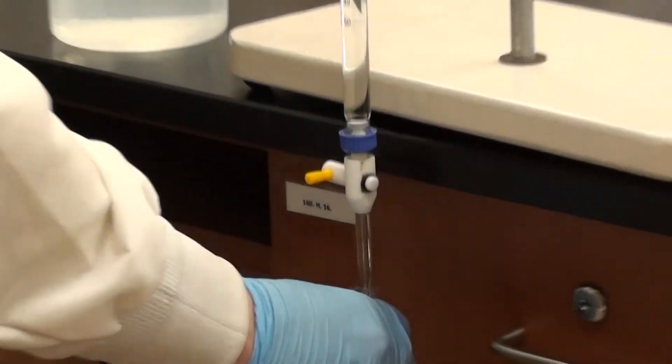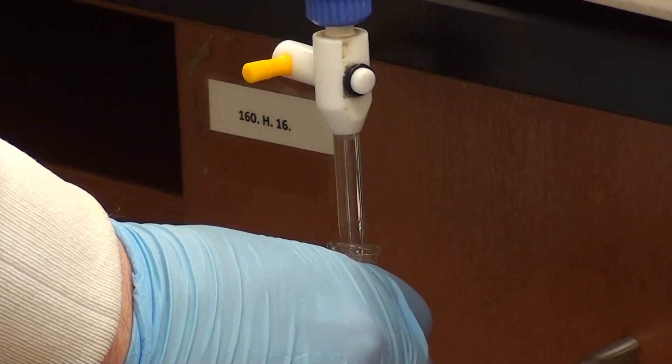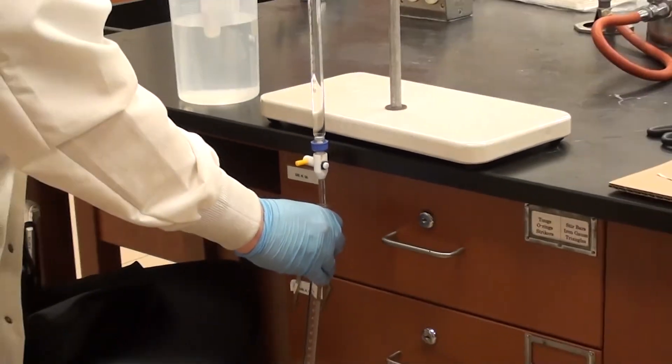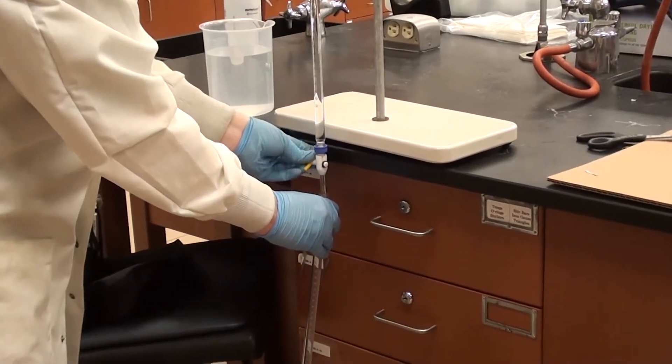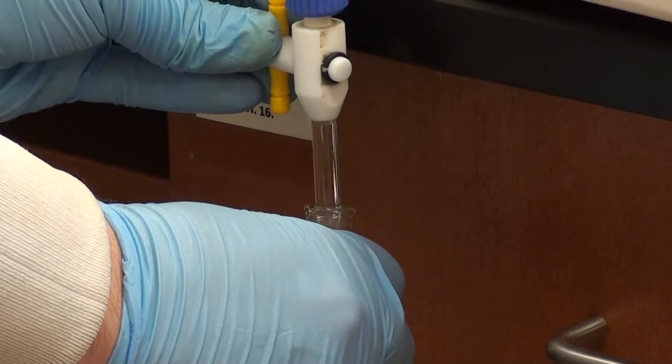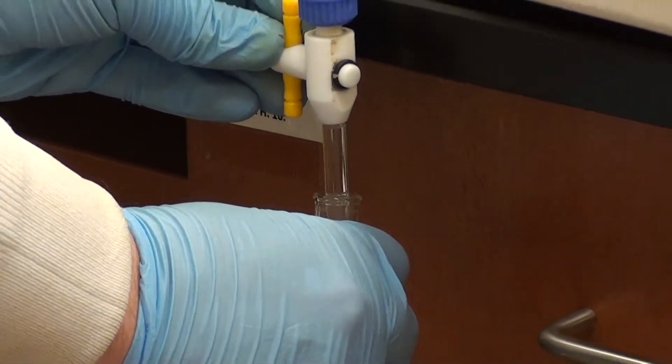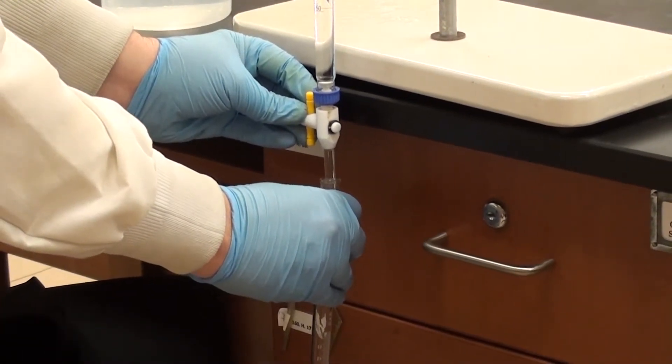And as you can see, the best technique here is basically to use a burette stand and to have it hanging off the table rather than trying to lift up and do it that way. So I'm just going to put in about 40.00 mils. It doesn't have to be exactly that, somewhere in the ballpark though.